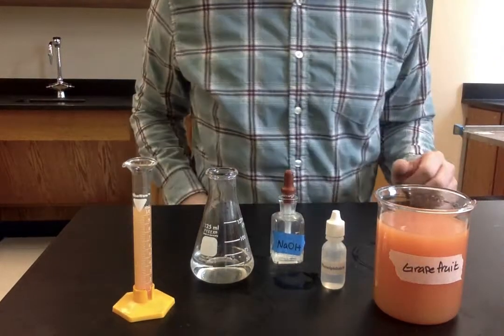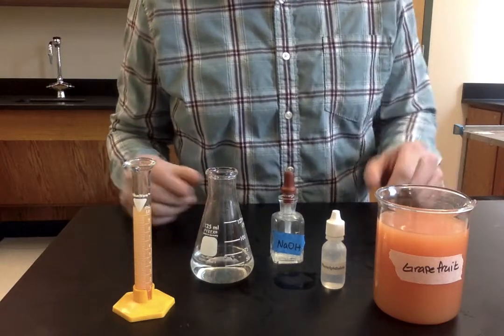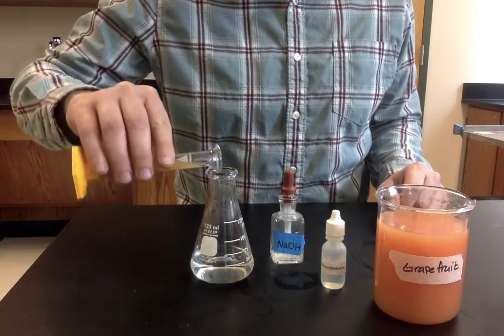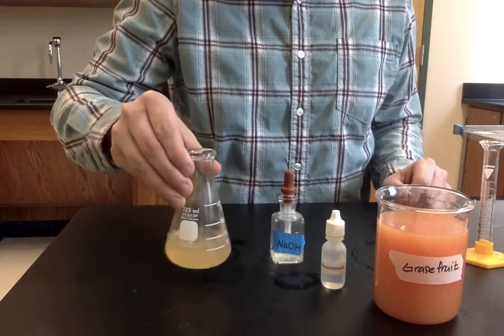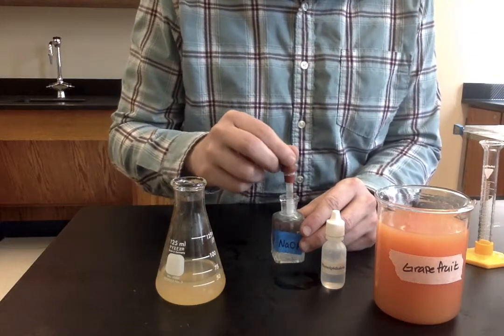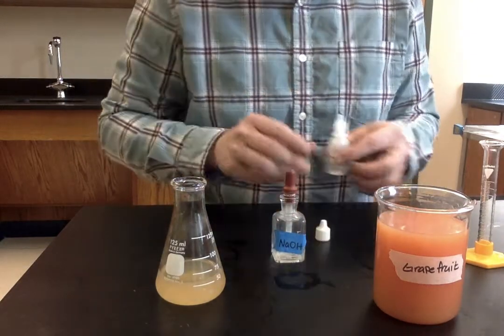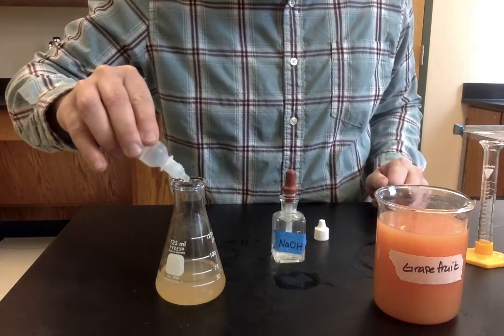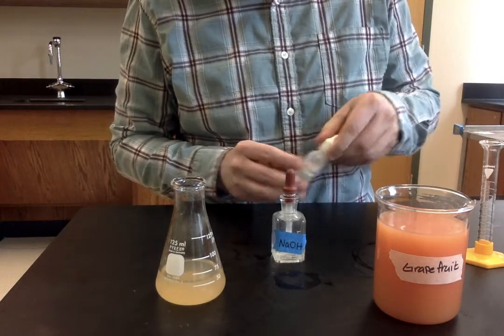Okay folks, second trial of the acid-base lab. We're going to be dealing with grapefruit juice, so we'll go ahead and dump that in. Whoops, I need to add my indicator. Now you keep track of how many drops of NaOH I have to add before this changes color.